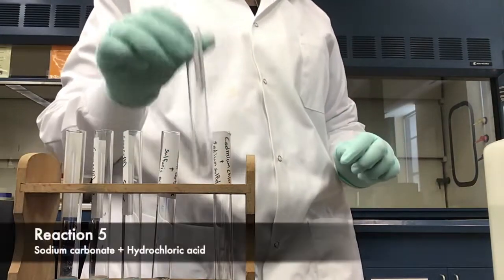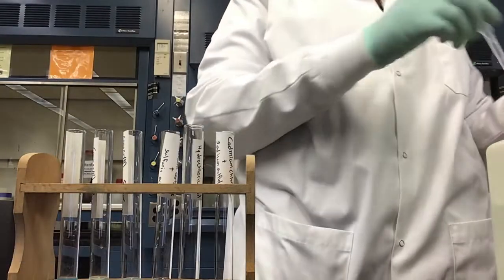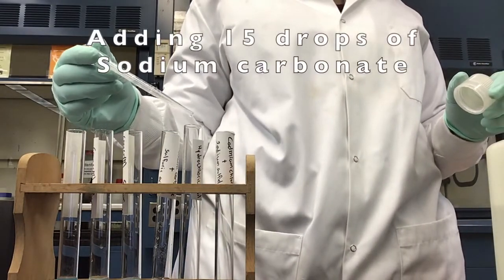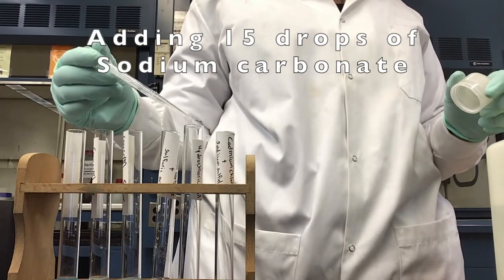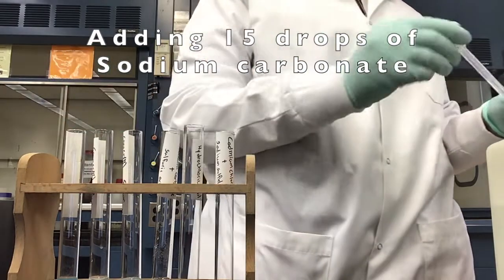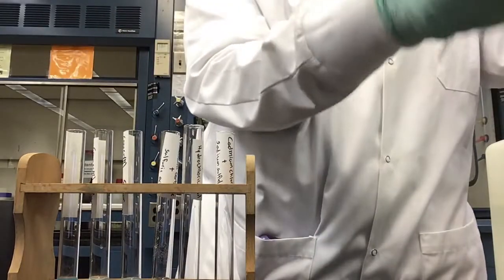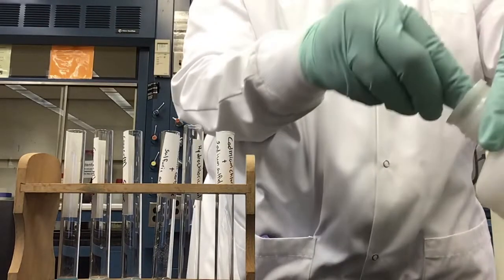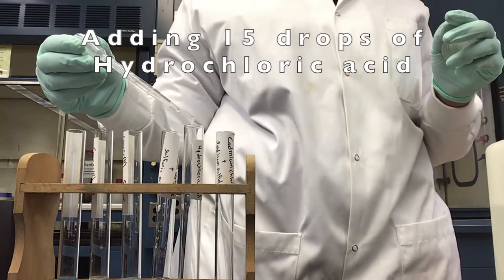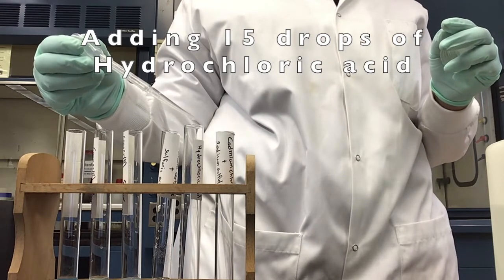Fifth reaction is sodium carbonate and hydrochloric acid. We're going to start off by adding 15 drops of sodium carbonate to our 5th test tube. Having added our 15 drops of sodium carbonate, we're now going to add 15 drops of hydrochloric acid.